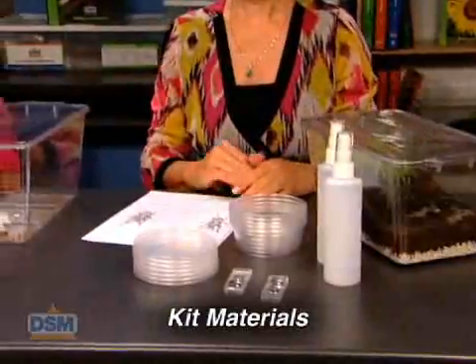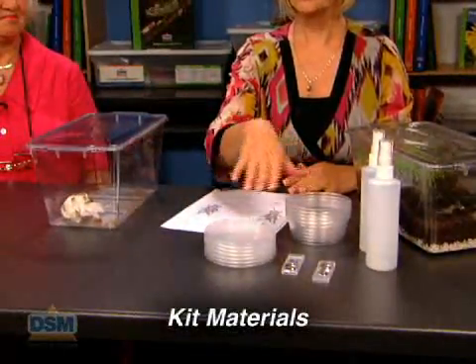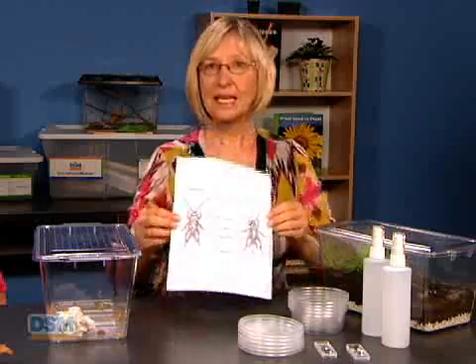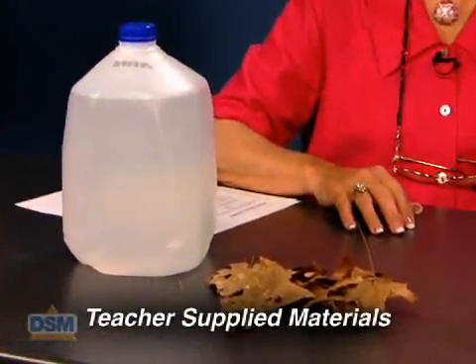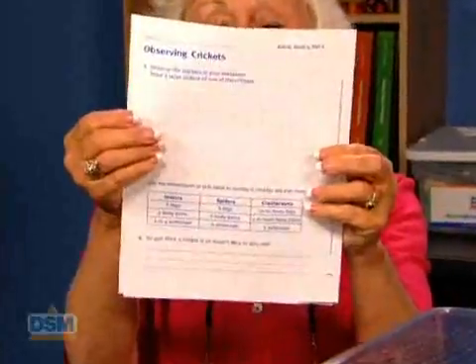For the class, you will need crickets, small plastic containers with lids, 2 spray bottles, and the cricket transparency. In addition to the kit materials, you will also need to supply 8 medium to large dead leaves, overhead projector or projection device, spring water, and copies of Activity Sheet 4, Part A and B for each student.